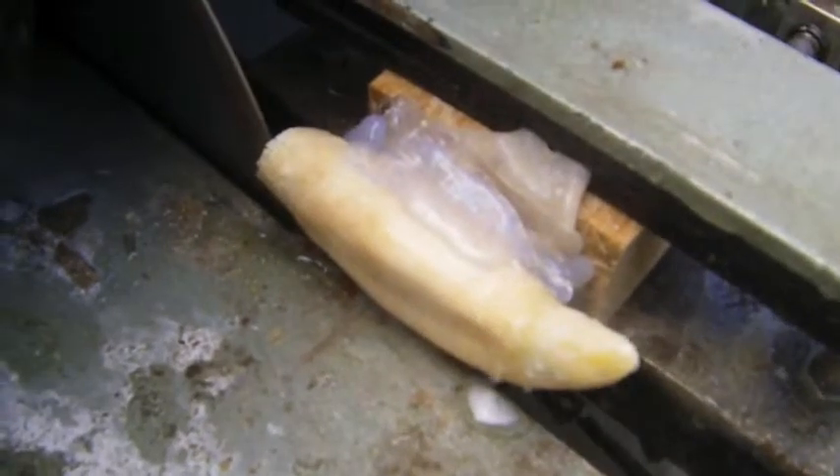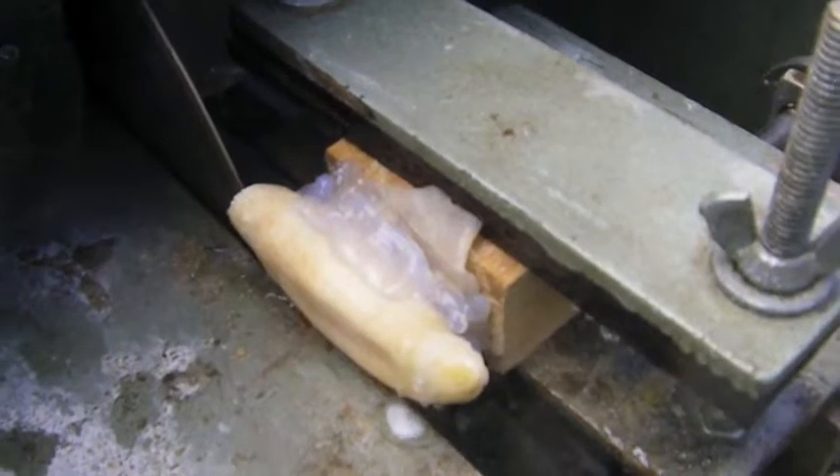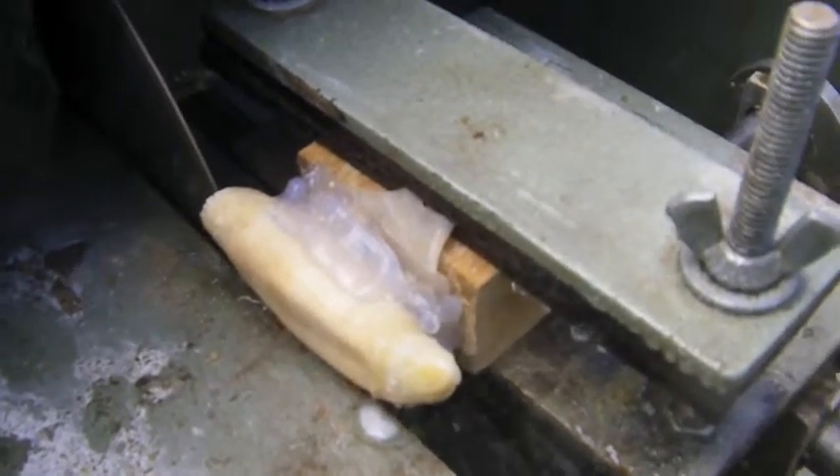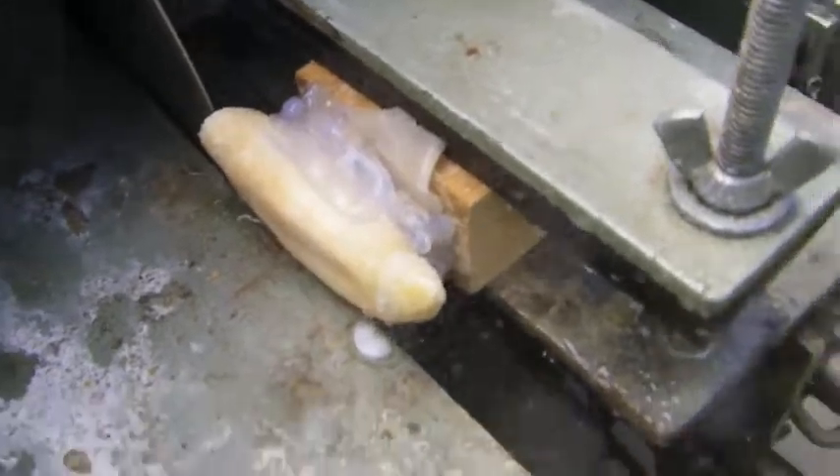This is a little bit louder now. The saw is going — you can see the water is flushing through. Now I just have to turn the switch here, and it'll feed the tooth straight into the saw blade. We'll come back in a minute.